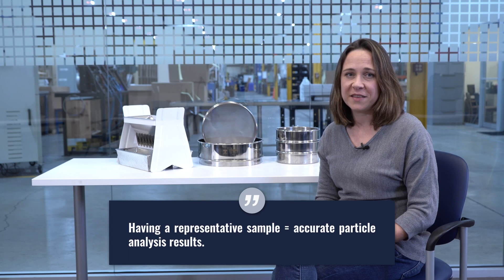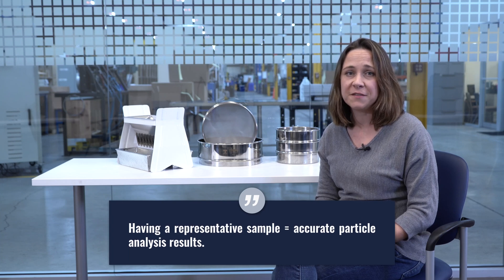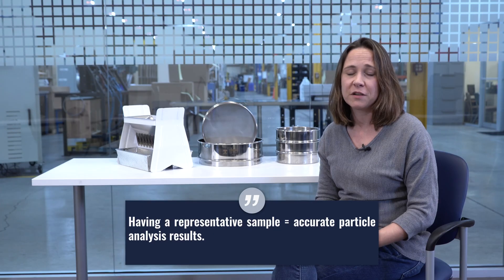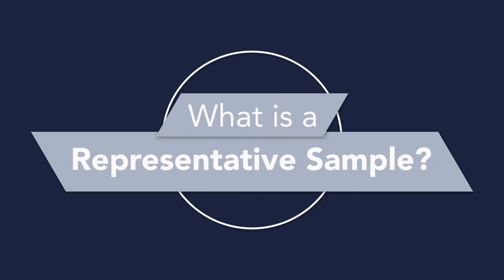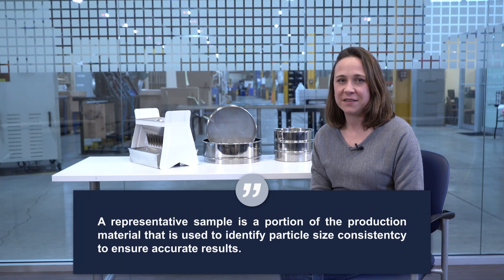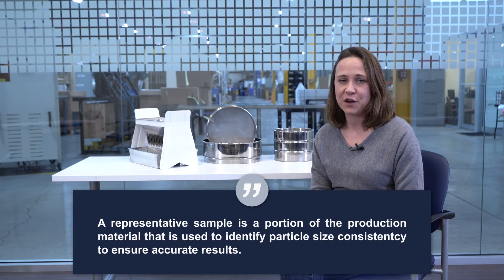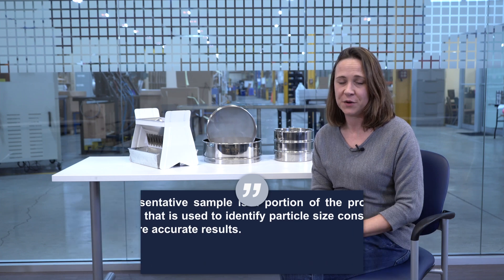But why would you need to know about these two methods? Simply put, having a representative sample is inherent to having a good particle analysis. A representative sample is a subset of a larger group whose characteristics accurately represent those of the entire group. Labs doing quality control using test sieves should have a representative sample that's made up of mostly dry, free-flowing material.